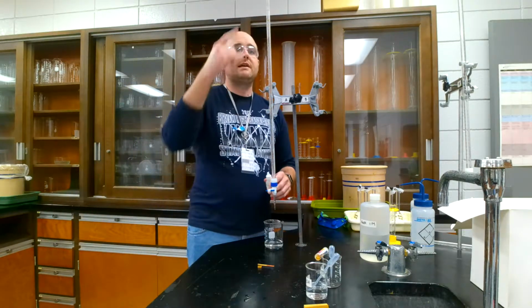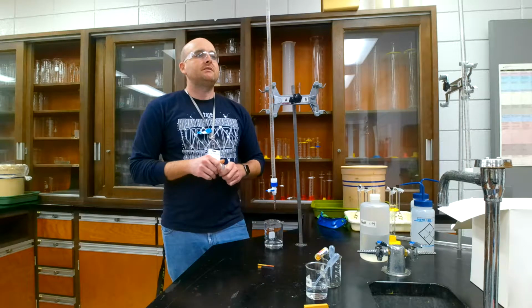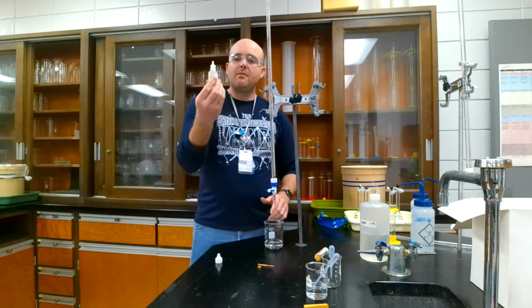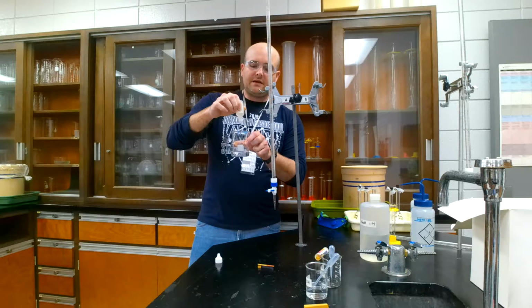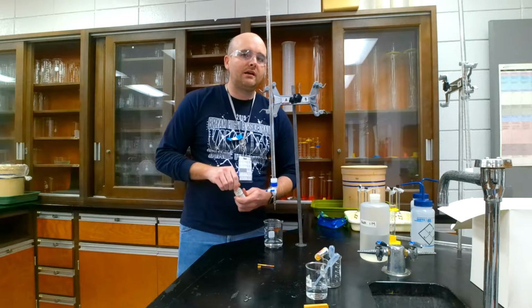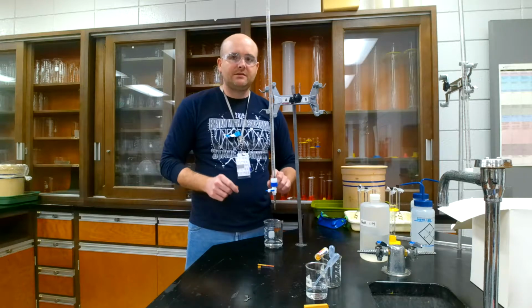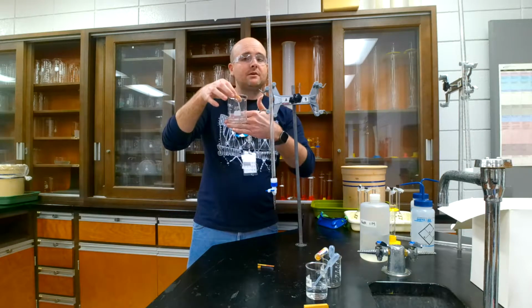Now what I'm going to do is, as I add the acid and the base together, they are going to neutralize each other. And so they will eventually make salt and water. But I won't be able to see the neutralization because they're two clear liquids. It will just make another clear liquid. But if I add an indicator, this is called phenolphthalein. Now, phenolphthalein does not change the pH of the solution, but it will change colors when the pH changes. So right now, note the color. It actually has no color, colorless.